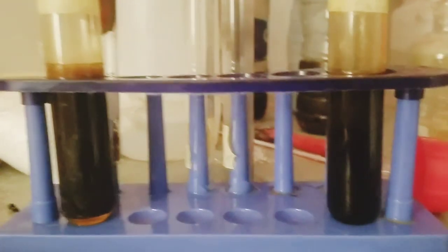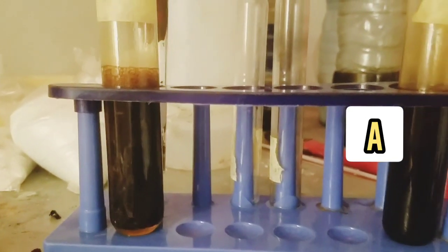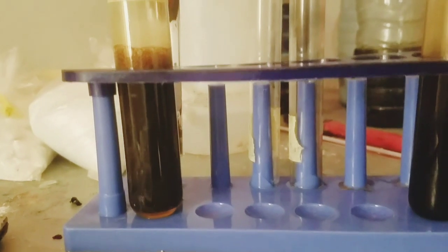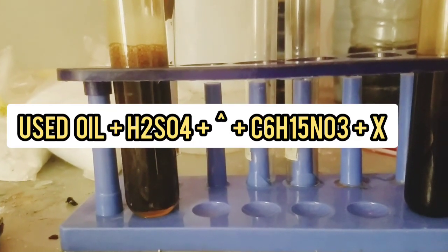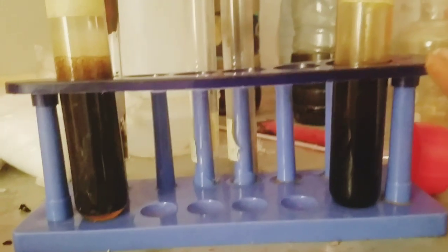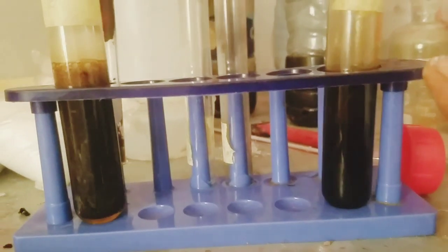The one by my right, which is this, is labeled A. You can see this labeled A, this labeled B. Now, the A is a solution of the clouded oil, that is the used oil, with sulfuric acid plus heat to 40 to 50 degrees Celsius, plus triethanolamine. But it is dormant.